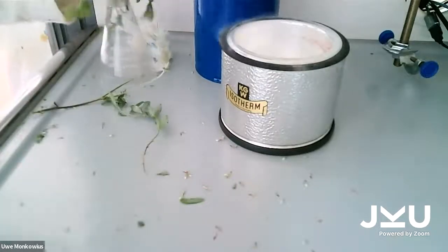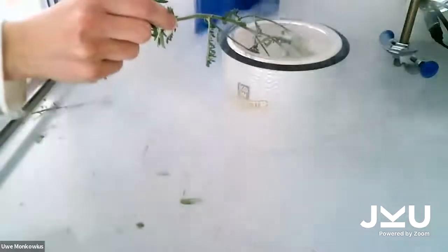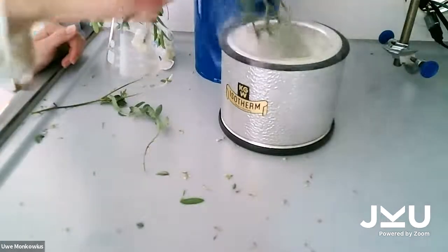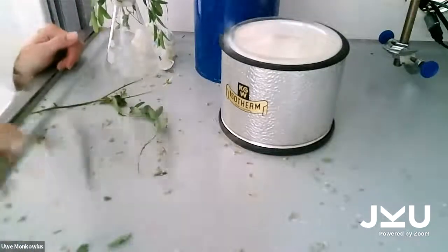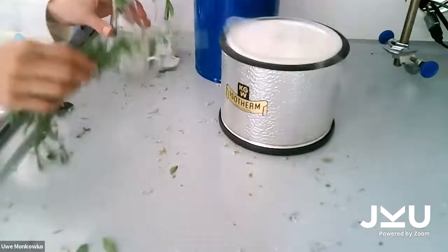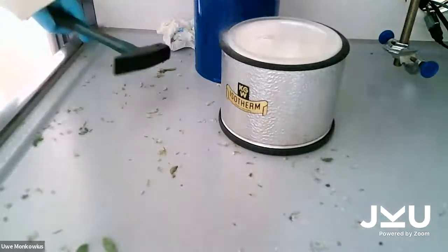Let's see with the bigger flower. See, it's totally soft, and when I put it into the liquid nitrogen, it gets hard and breaks into a lot of pieces. Sounds like glass a little bit. Okay, then Martin will be very brave and will show you some really dangerous experiment.